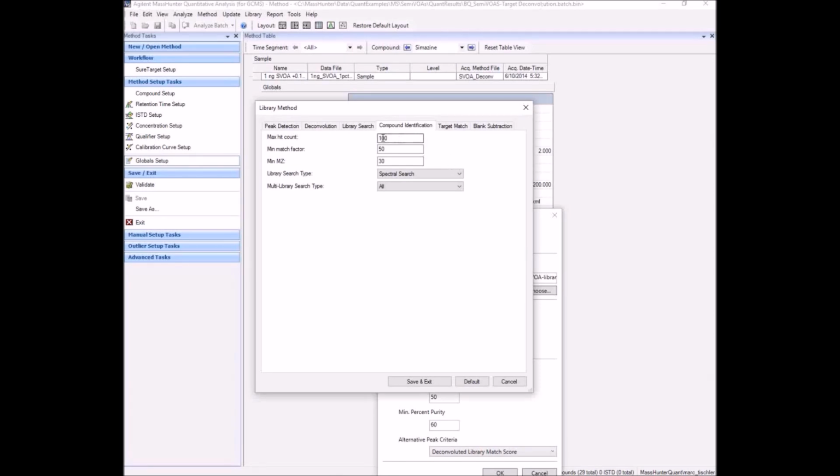The other part of the method setup is the compound identification, and we've set the max hit count to 100. So it will go to NIST and pile up a list of up to 100 hits which meet this minimum match score, and then compare it against the target match score. And if any of those have a better library match score than the target that you found, it will provide that information to you as an alternative hit. So it will keep a maximum hit count of 100. That is patterned after the ChemStation DRS, Deconvolution Report System approach.